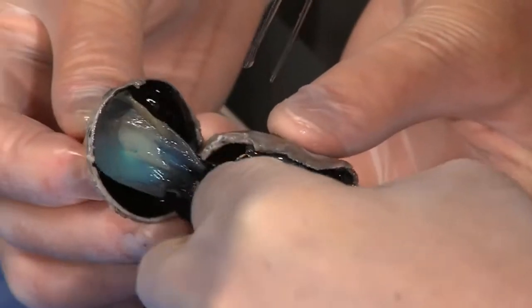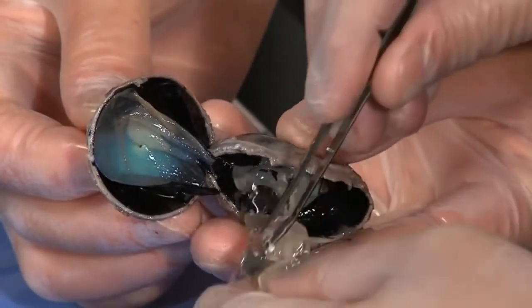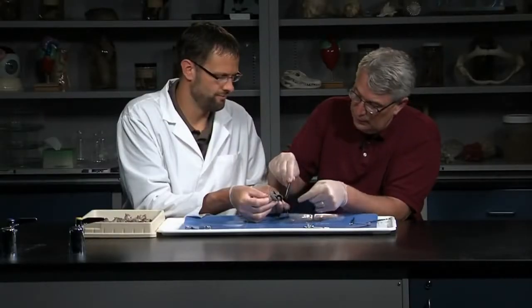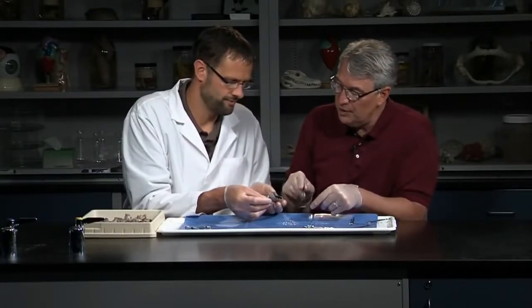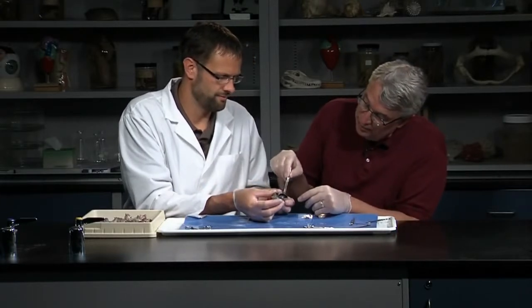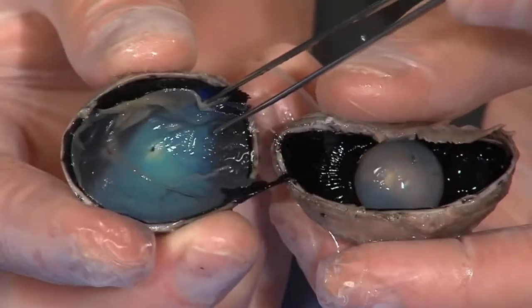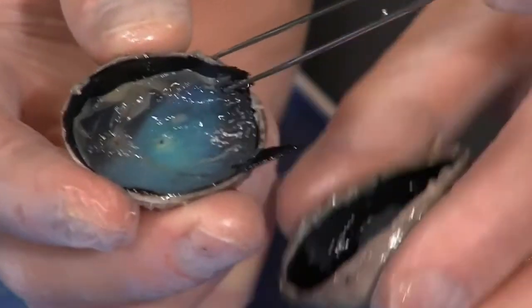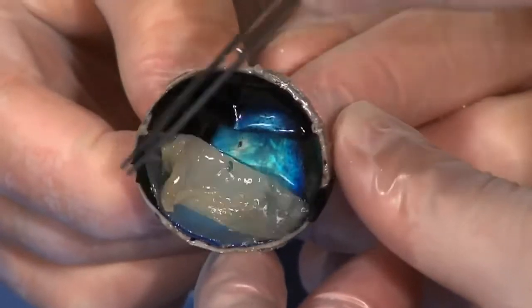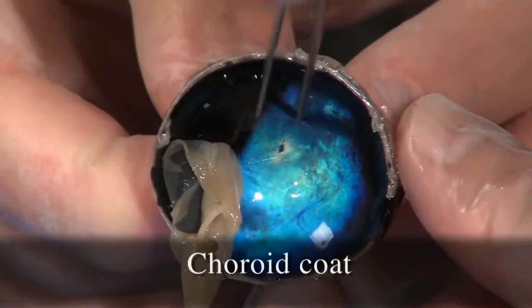It's very jelly-like and it does kind of want to hang on, so you pull it all out of there. Now we can see some other structures in there. Here's the retina. If I pull the retina down off of there a little bit, you can see that there's a dark layer there — this is the choroid coat.